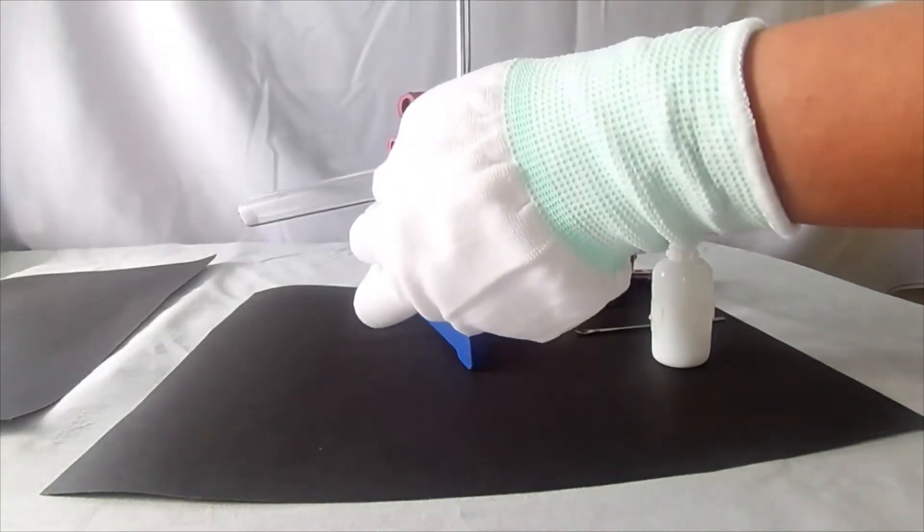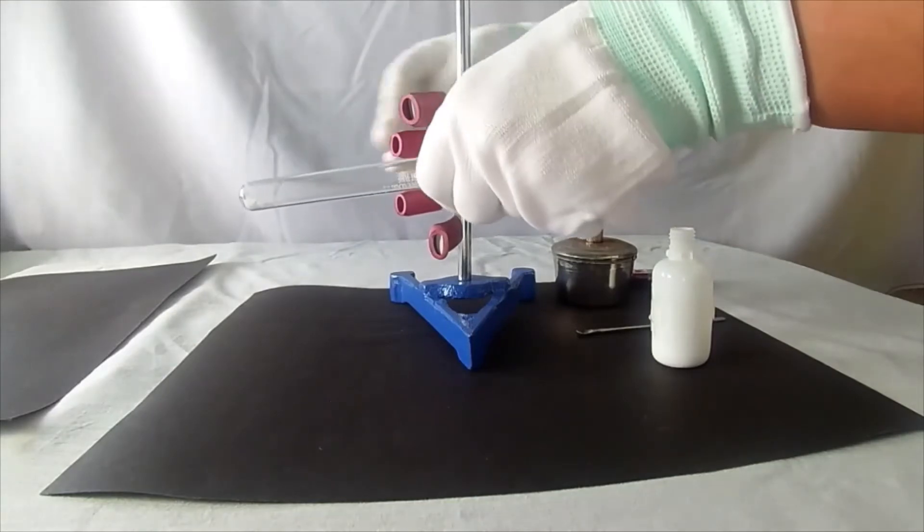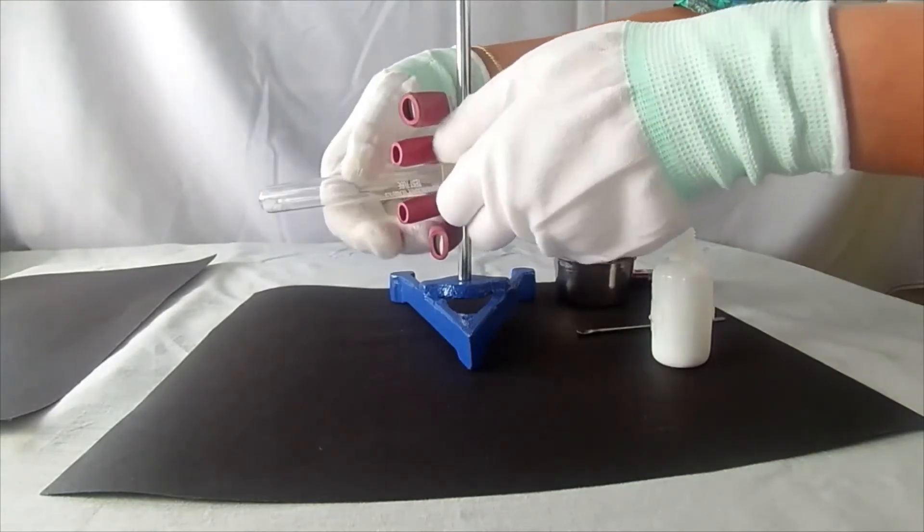Fix the test tube onto the iron stand carefully in a slanting position.